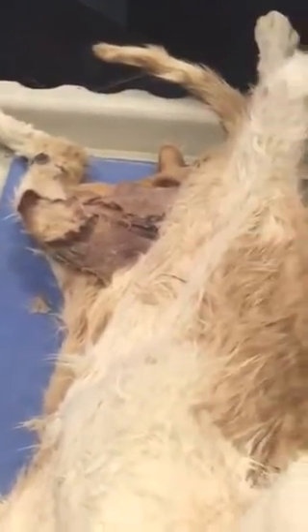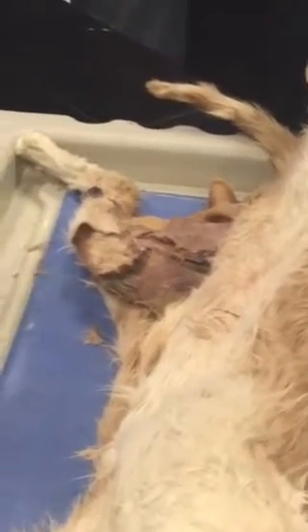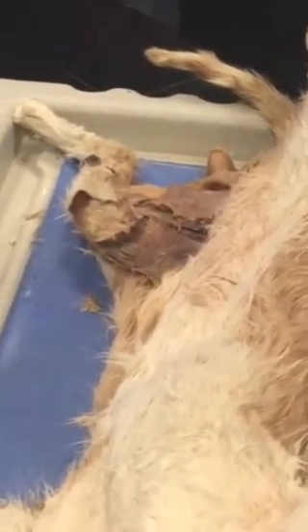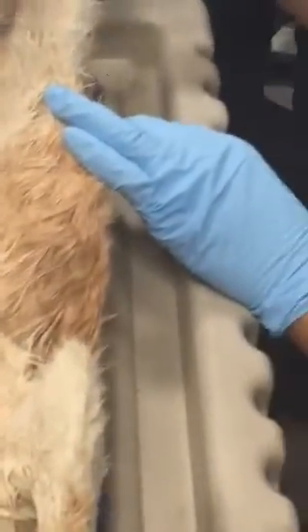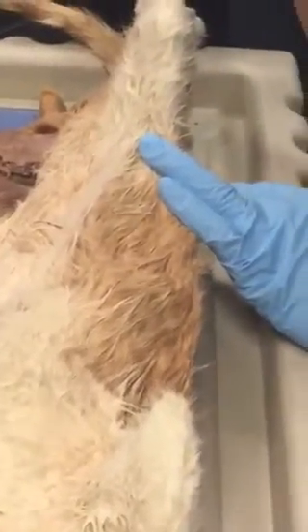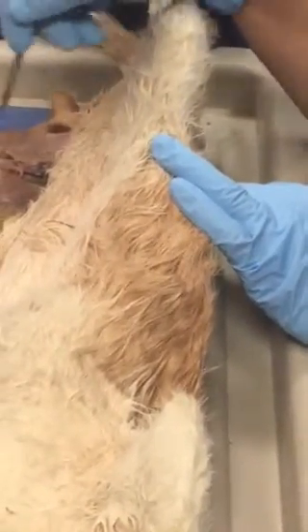So Sartorius is more anterior, does it make sense? Where gracilis is more posterior. In humans, Sartorius is much longer and thinner, and it's at an angle. But in the cat, these two are parallel to each other, but still one is anterior. So which one is anterior? Take a look. Sartorius. Which one is more posterior?